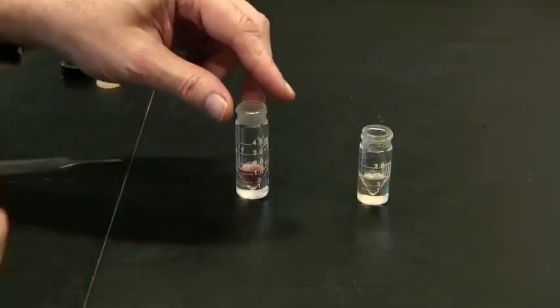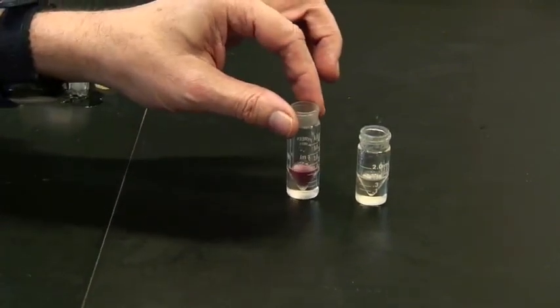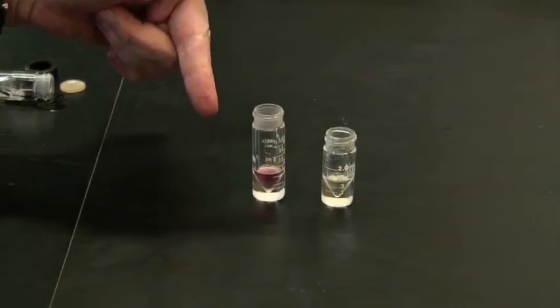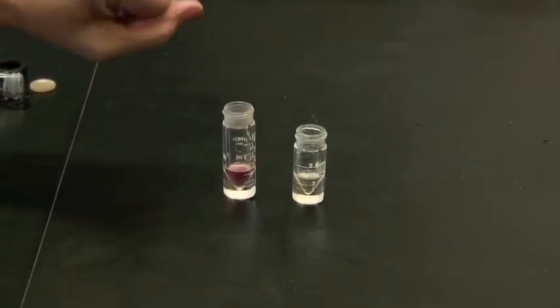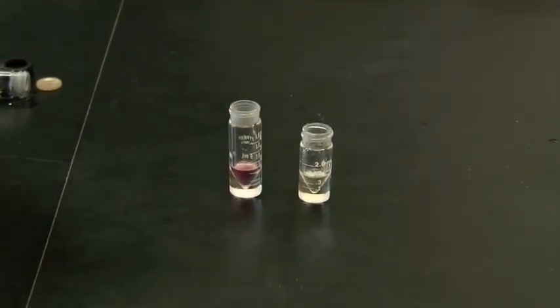Transfer into another vial. And then this vial, which is the purified solution, the organic, with a little water in it, you'll need to dry. Use exactly the same steps as you did with a less dense organic fluid to dry this and bring it to completion.